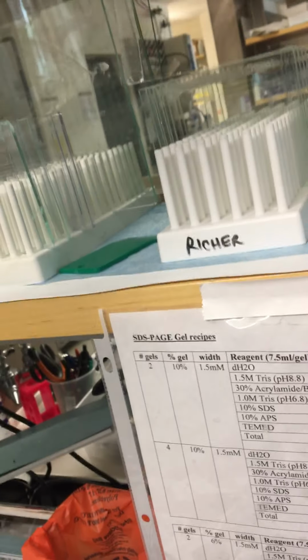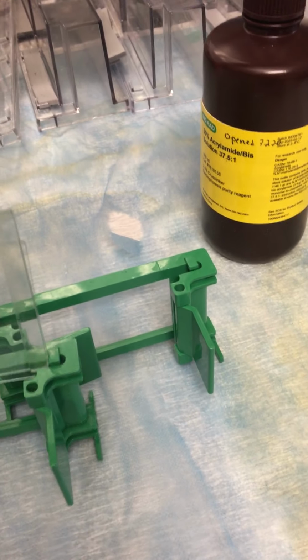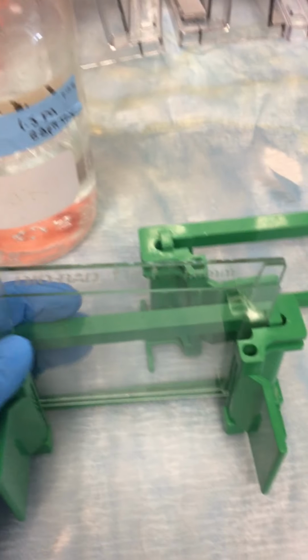Although I will say, this glass plate has a little dent on the bottom, and sometimes the gels that have this will leak, so I'm actually just going to throw that way back there and use a different glass. We have plenty of glass plates, so if ones are a little chipped, usually I try not to use them. So again, I've just put these two together and I put them in the green thing.